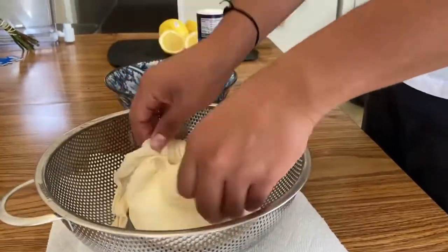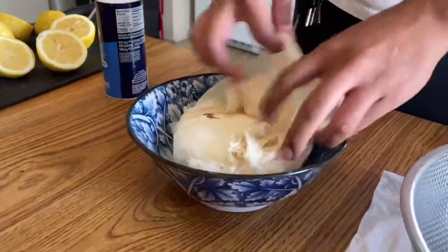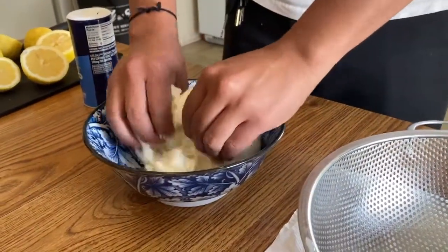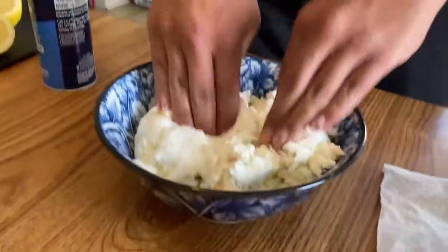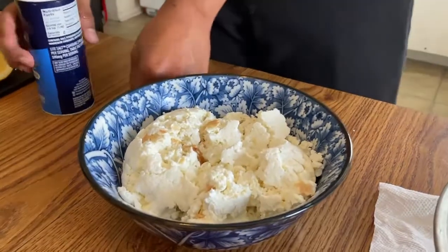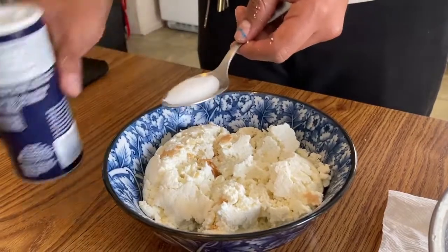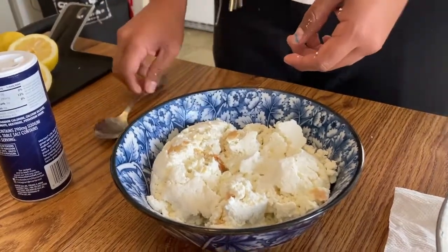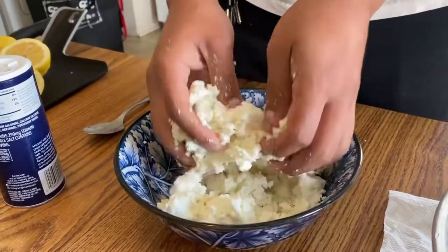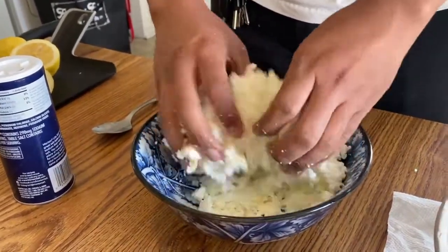And then we're going to remove the cheese from the colander and from the cheesecloth once it has dried sufficiently. So it's going to be like a 20 minute wait to dry it out fully. And what we're going to be doing here is salting it. So the salt adds flavor to the cheese that we want, but it also helps extrude some of the water that is still in the cheese curds. This is due to an ionization gradient. And you can see that we're mixing in the salt all throughout the curd.